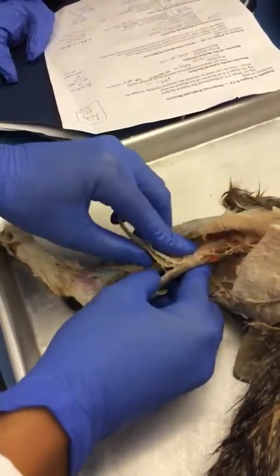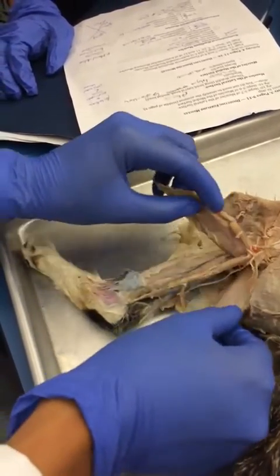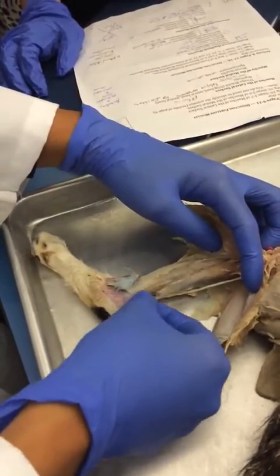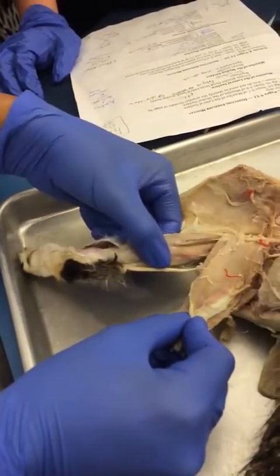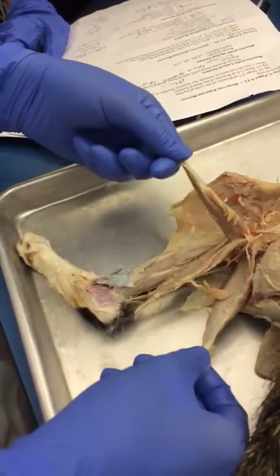Okay, so the last thing is the calf muscles, right? So what are these two big ones, the lobes? Gastrocnemius. Good. You pull those apart. What's planted inside the gastrocnemius? Plantaris. And then what's next to the bone? Soleus. And all these are connected to the Achilles, right? There are other muscles on the bone itself, but you're not responsible for those. You're only responsible for the ones that are connected to the Achilles.